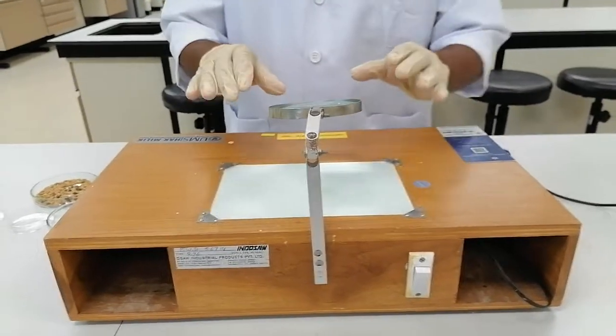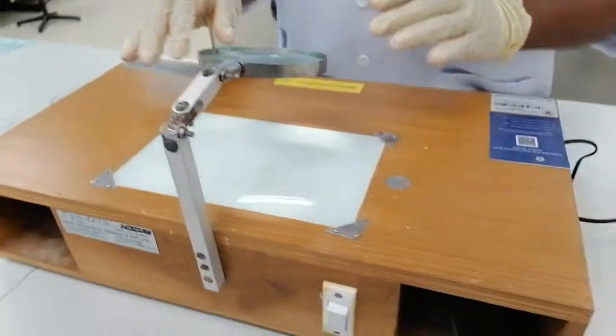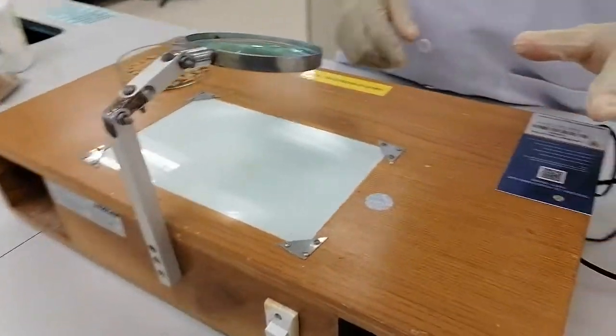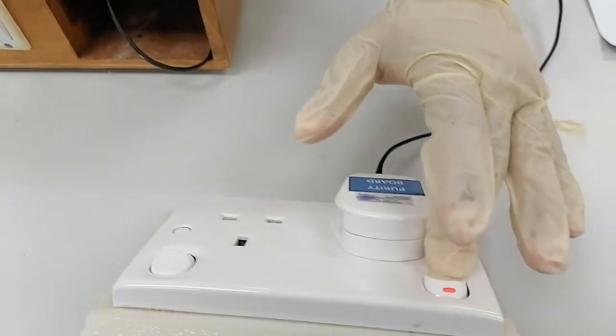This is the power glass here. In between where we want to use, there is the power cable. When we switch it on, you can see the light.